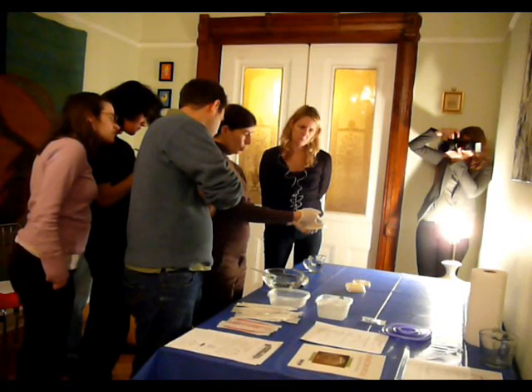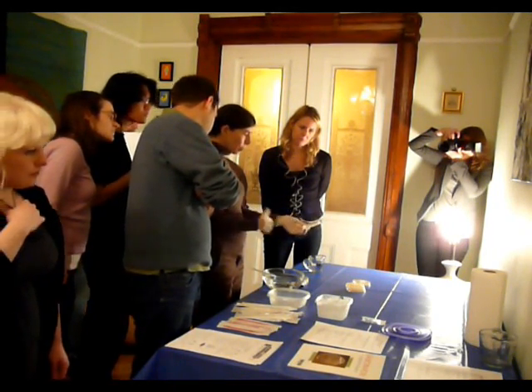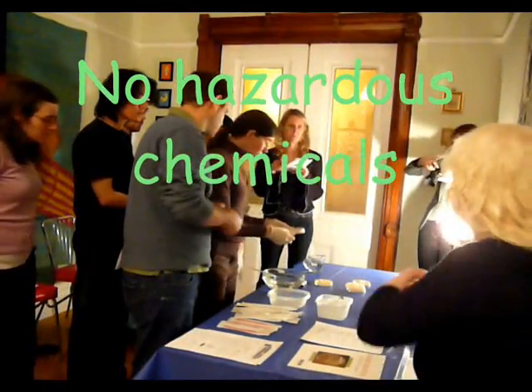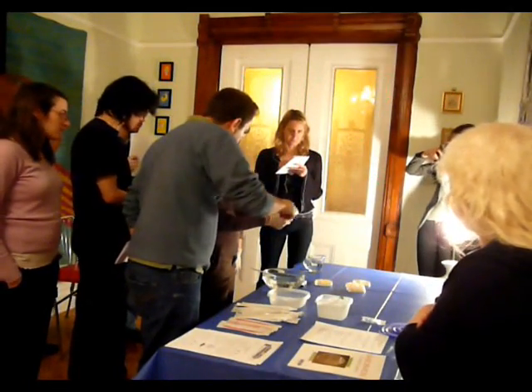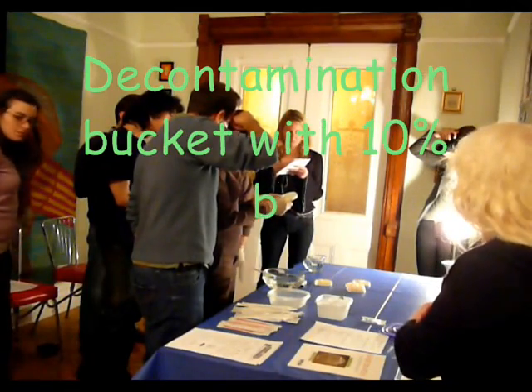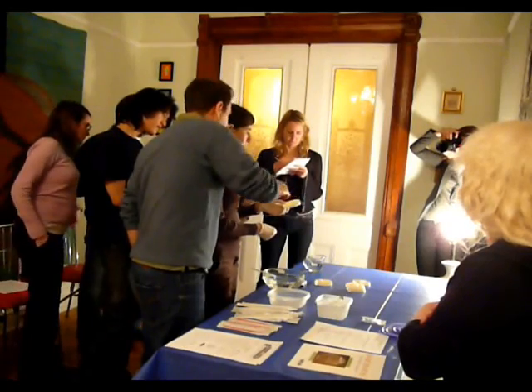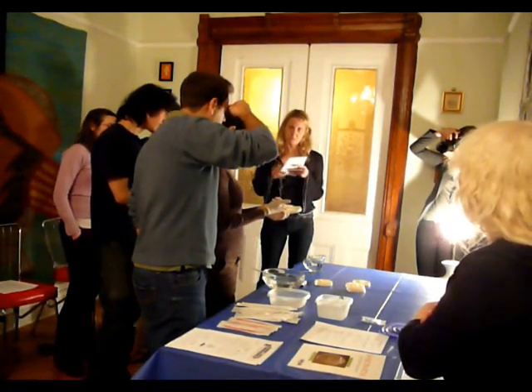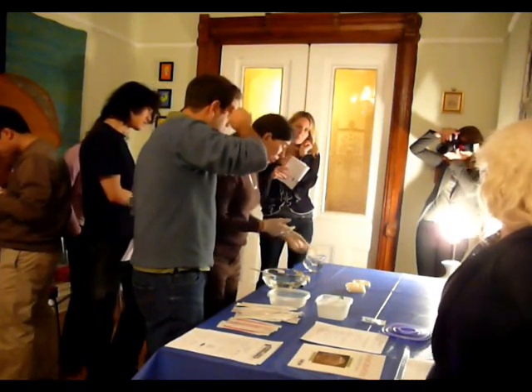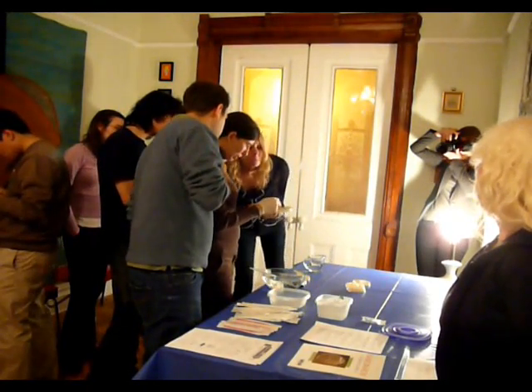And then you drag it through just one. Are we just transforming with a GFP protein? Yeah, exactly. This is actually a kit used for high school students, mainly APs, so the kit was shipped here, and she started growing them yesterday, and she's got them in log phase growth, which is what you need them to be in for the best transformation. This stuff goes in the plus tube because it looks better.